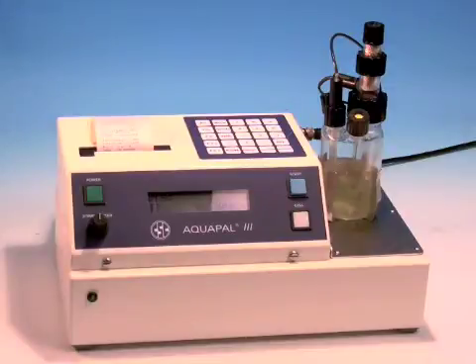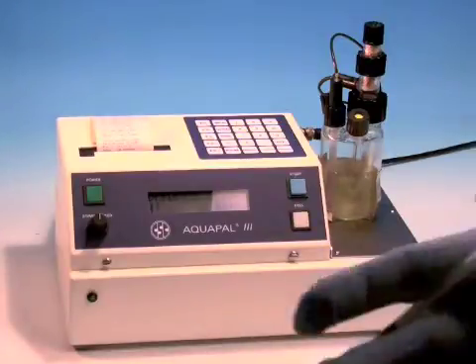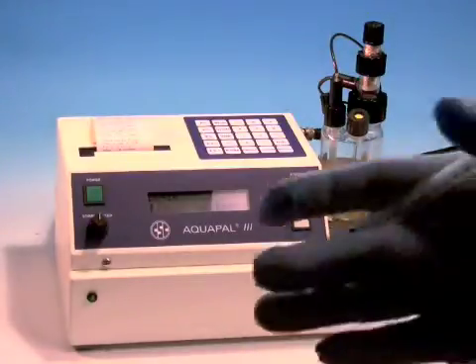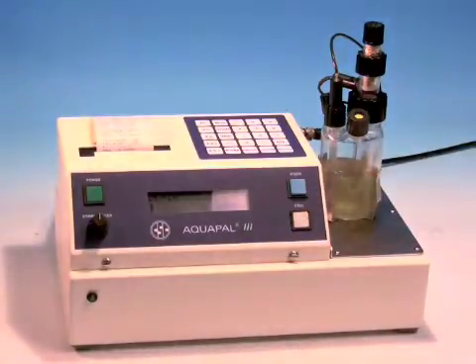Unlike the other two popular water standards, 0.1 and 1.0, where you're trying to get within an error range of 10 ppm or 100 ppm, that's 10% variability on that water standard, or the 1.0 which is 1,000 parts per million plus or minus 3%, which would be 1,030 or 970 ppm.